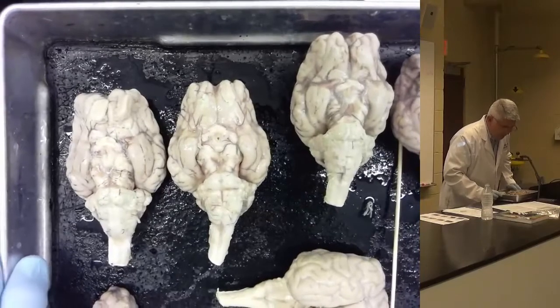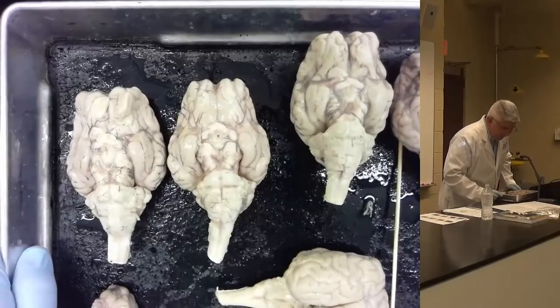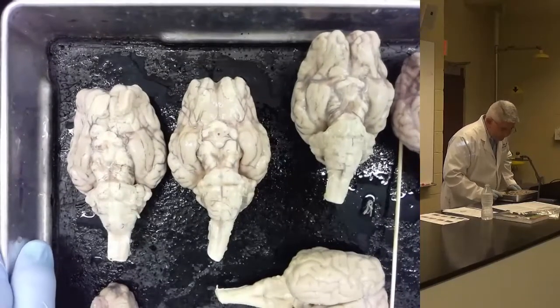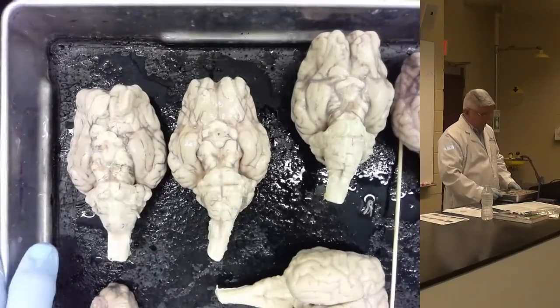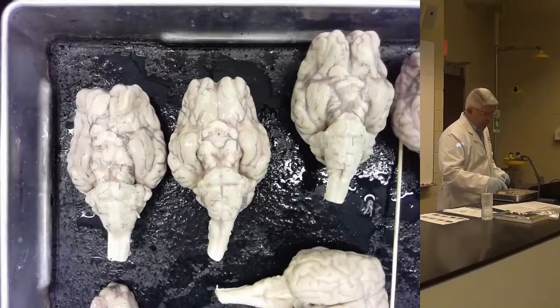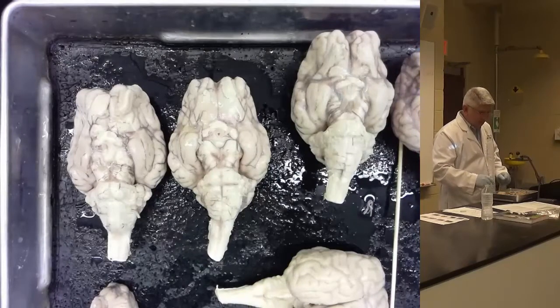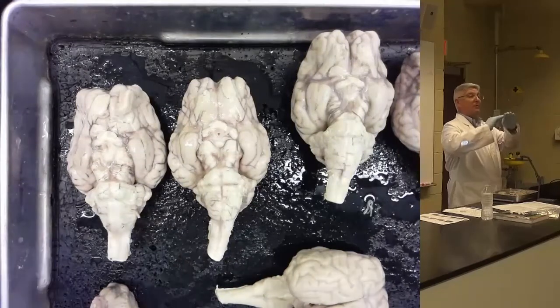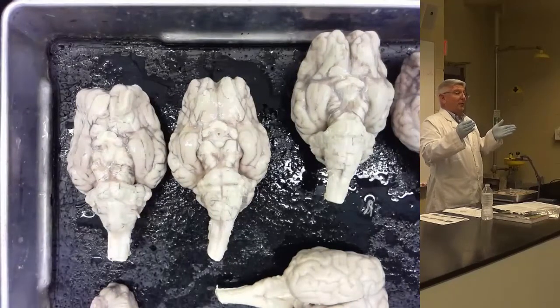Since I'm on the bottom of the brain, let's skip over cerebellum, and we'll do that last. And I'll come back to the specific human gyri and do those last 2. All right, so if you go down to part C, where it says rhinencephalon, this is where we're going to pick up. So, and now we're oriented. What part of the brain are we looking at?